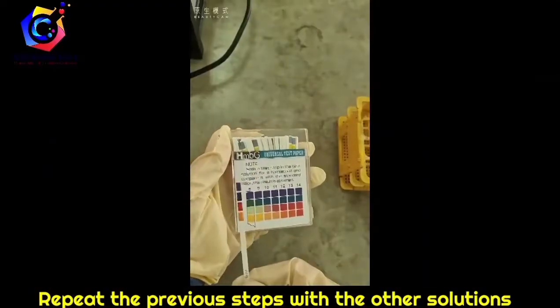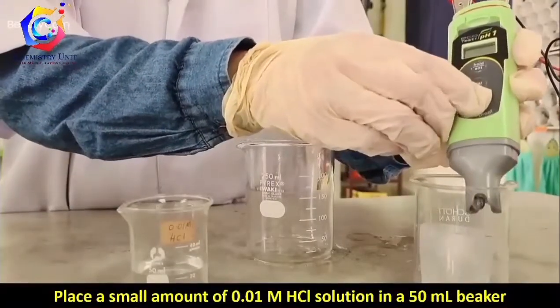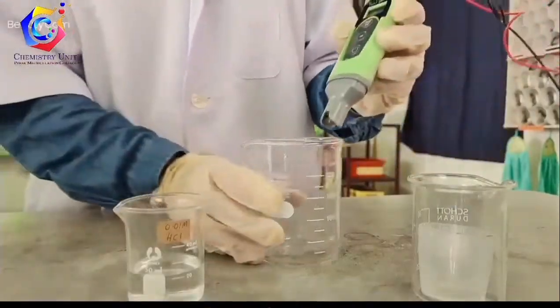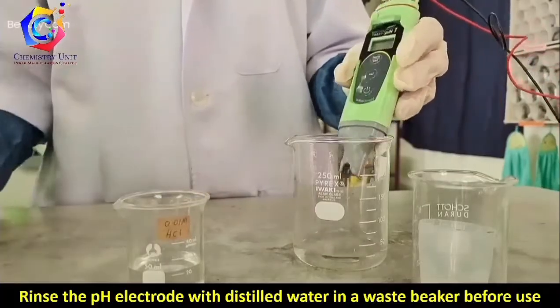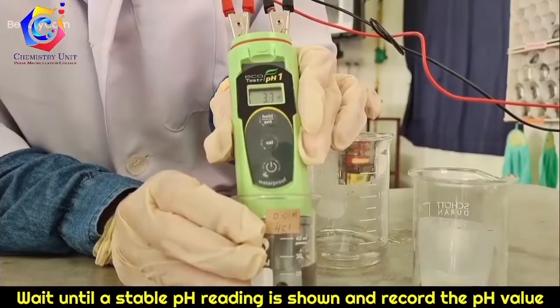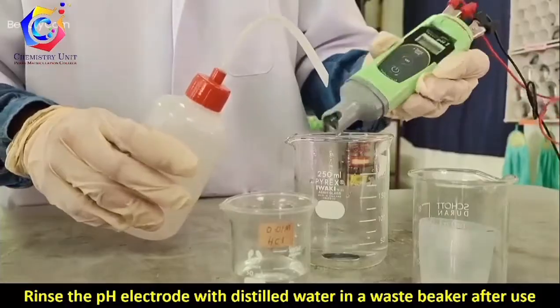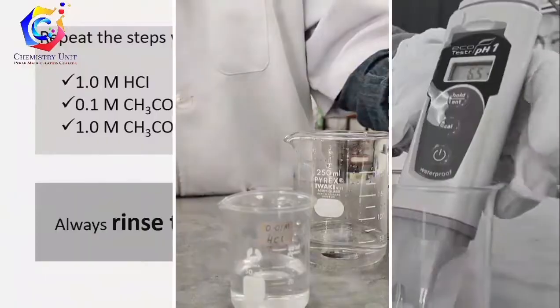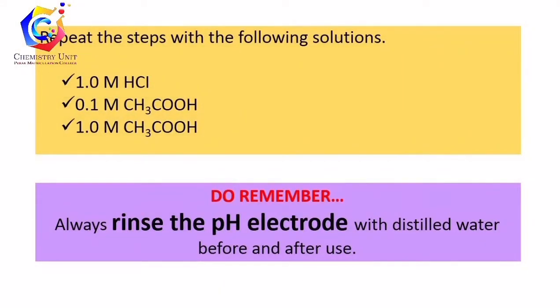Repeat all the previous steps with the other solutions. For the pH meter: place a small amount of 0.01 molar HCl solution into a beaker and turn on the pH meter. Rinse the pH electrode with distilled water, then place the pH meter into the solution. Wait until a stable pH reading is shown, record the pH value, and rinse the electrode with distilled water after use. Repeat with the other solutions.